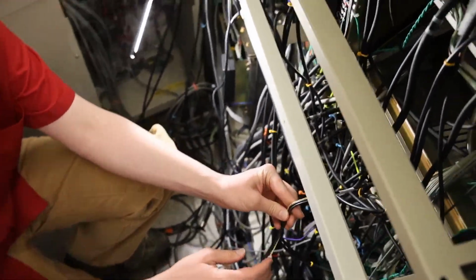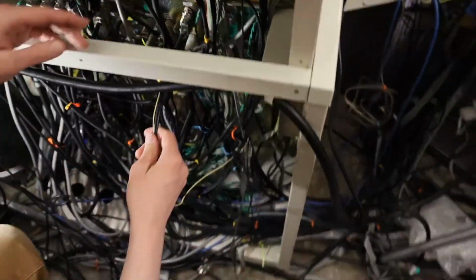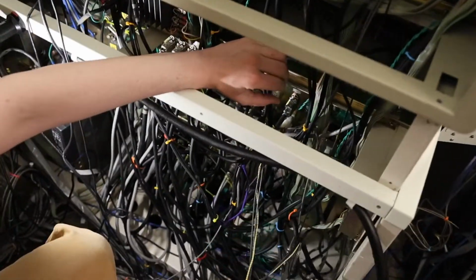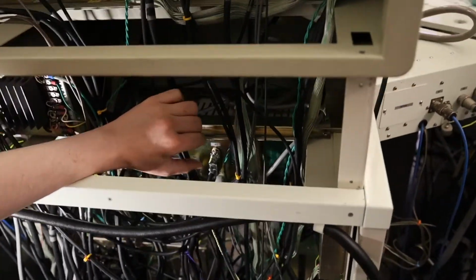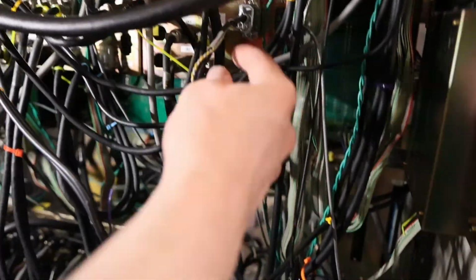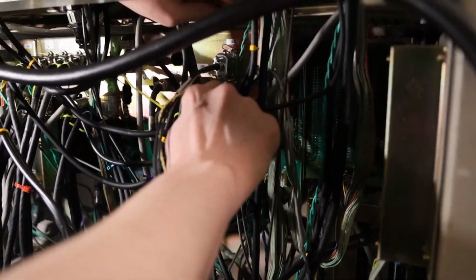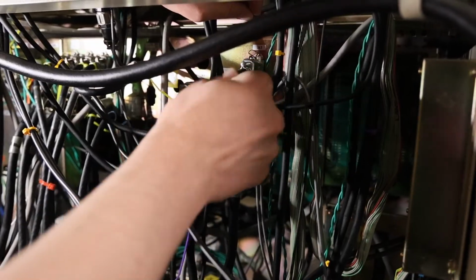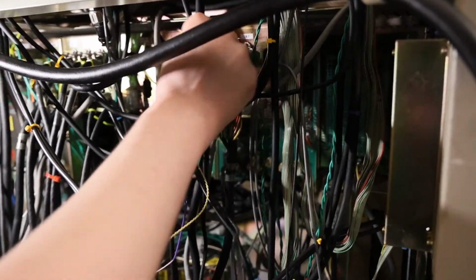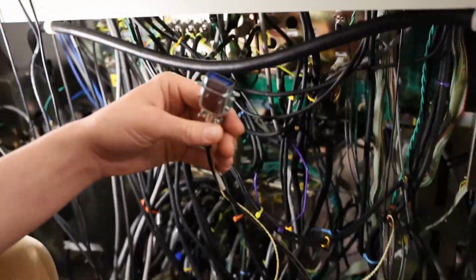It is plugged into JA2. I misspoke earlier, I said JA7. JA2 is this microscope's external scan port. So with this plugged in, we don't really have any room for open beam interface to be added in here. So we're going to go ahead and remove JA2, which is currently coming from NORAN System 7. I didn't quite release on the bottom there. There we go. So NORAN System 7 is now unplugged.